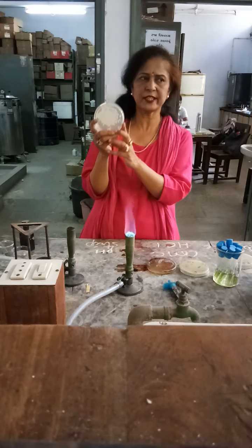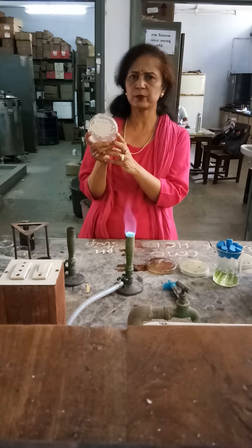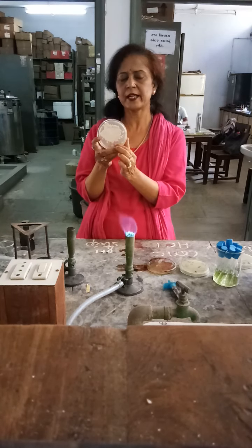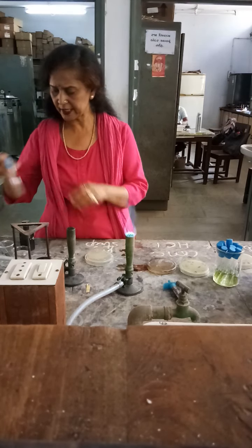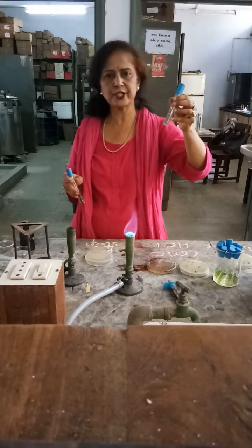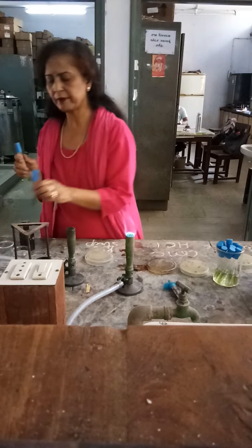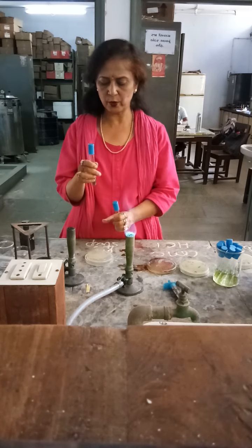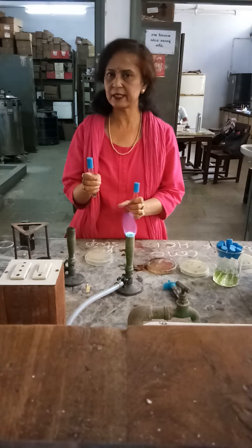Now about the Wilkins agar. Because we have already diluted our sample and started working from the third dilution tube, that is 10 to the power of minus 3, you will not get a complete lawn. Some area is empty and you can see fewer colonies. We have growth in our Wilkins broth, which we already inoculated yesterday with this dilution. Now this is our Wilkins top agar. We will add only 0.1 ml of the test organism to our Wilkins top agar tube, and then overlay it on the nutrient agar plate which already has bacteria from the soil sample.